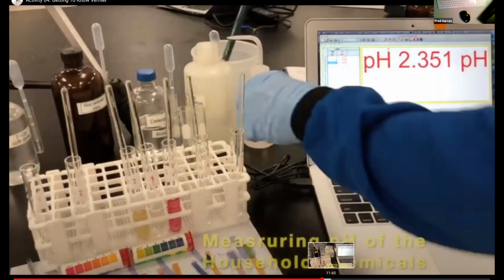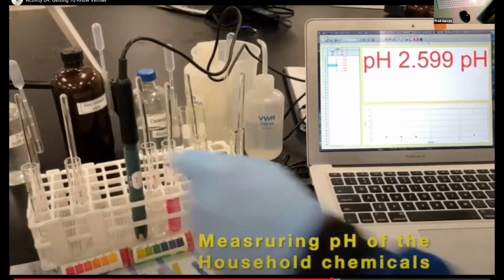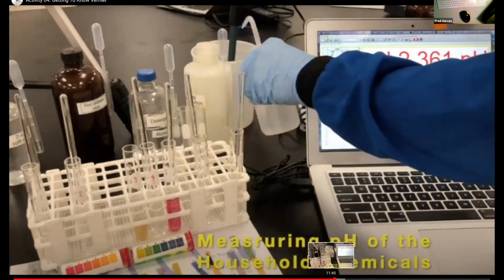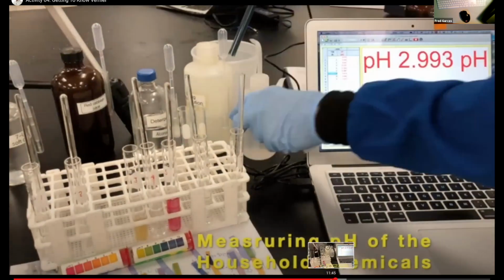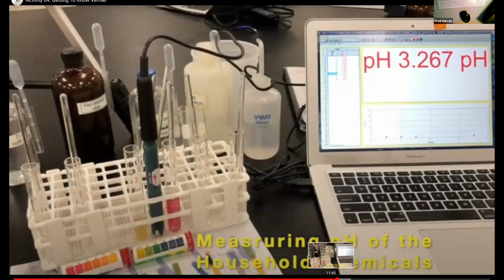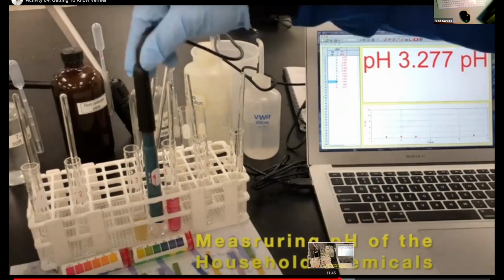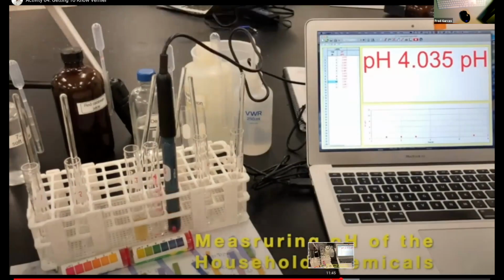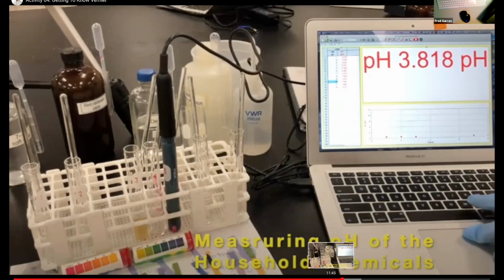Now I'm going to take the pH probe and put it in each of these solutions, and then I'm going to read the pH of each of these solutions. And I'm going to do it in triplicate. You always want to do things in triplicate, because if one of them is an error, then you have another 2 to see whether the error is on the high side or low side, or just to confirm that it's correct.